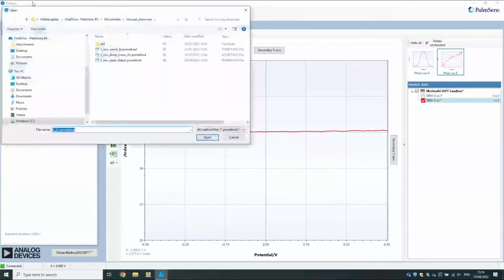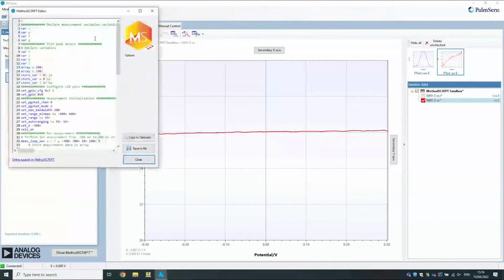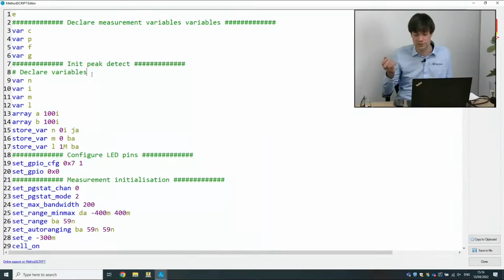Okay. All right, let's go to the next measurement. We're going to take out the things that we just added. Now we want to add in some different features. This script is going to show that you can do calculations in the script. So we're going to do simple peak detection here, and then we're going to draw some conclusions out of that peak detection. If the peak is higher than a certain value, then we're going to say, oh, we've detected something, and we're going to turn on a red LED. And if there's no peak, then we're going to turn on the green LED, because in this case, let's imagine that that's a good thing.